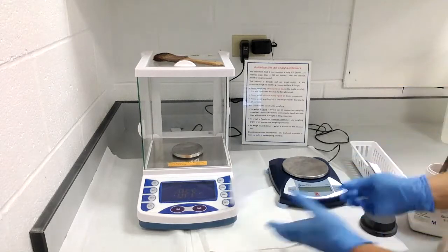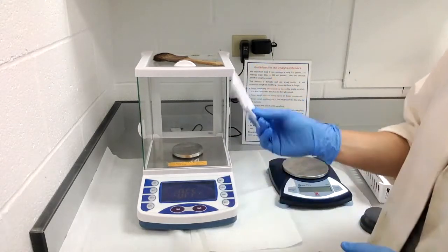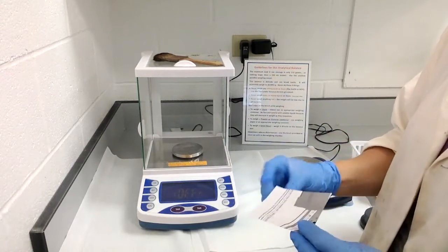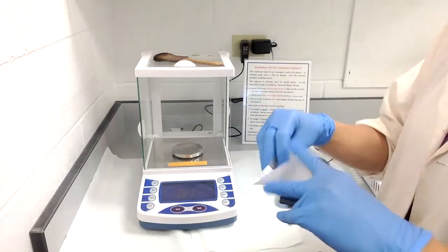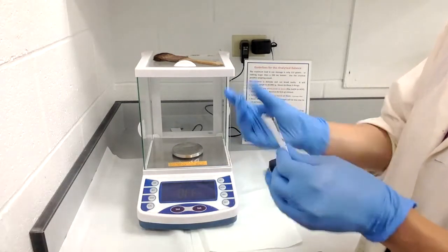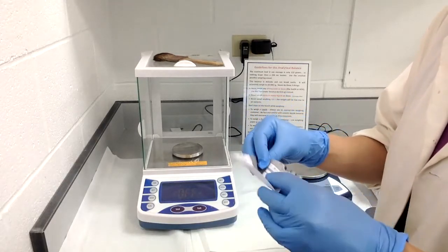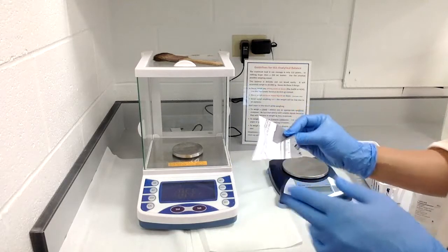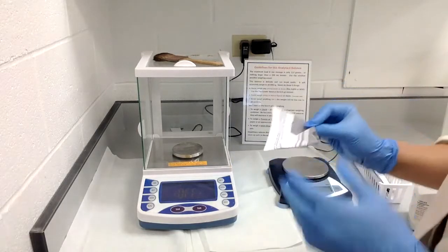For the majority of the time, we'll just use some paper sheets. The best way to turn a flat sheet of paper into something that's easy to carry a small sample in is to make some creases — just fold it in half and fold it in half again. These creases also make it easier to pour into your Erlenmeyer flask, beaker, or whatever you're using. So you've created a little tiny weighing boat for yourself.